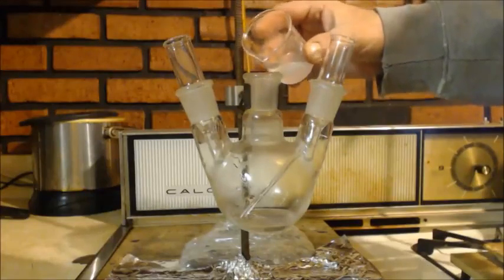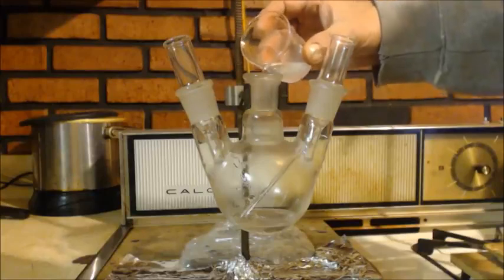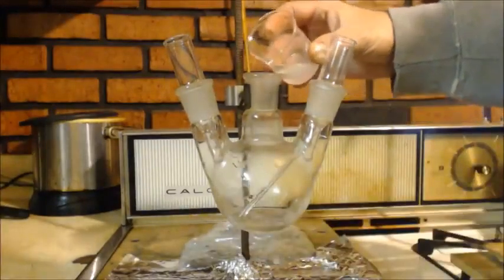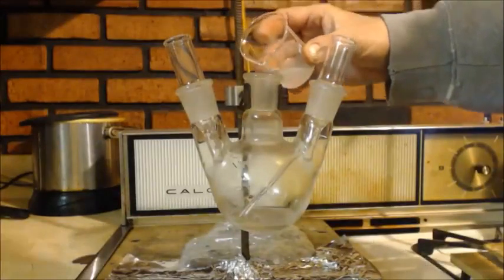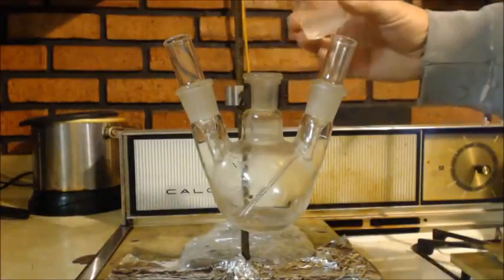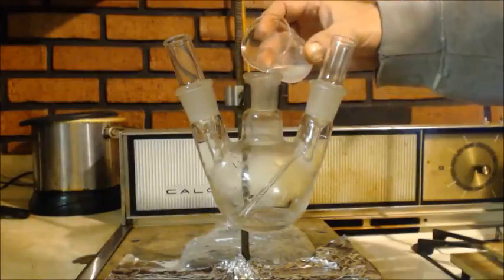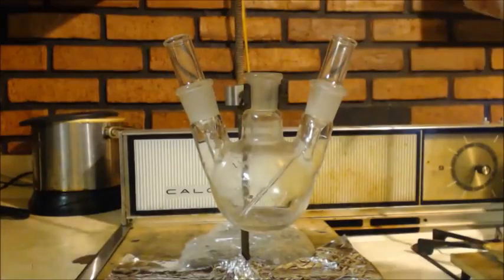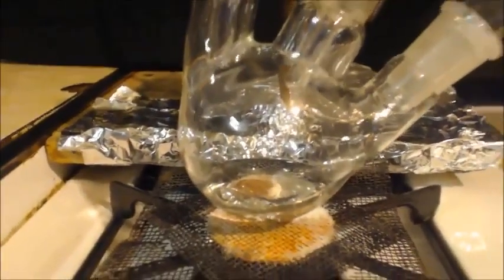Normally I would drip this in, but there's so little, I don't see the point. Anyways, I'm going to finish putting this in, and I'm going to let it warm up, start distilling, otherwise I'll crack the glass. All right, I dripped that all in. Can't see them because of glass, but I got boiling stones in there. And just in case things get crazy, I want to show you my setup.